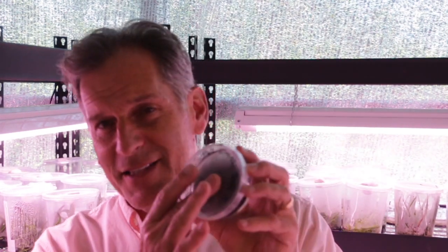The seed capsule yellowed at about the right time, and then I plated the seed. And I looked in here, and I didn't see a whole lot. The seed didn't look great. But it's now been 3 weeks. So it's been 3 weeks, and I actually can see it with a naked eye, but the plate is kind of cloudy, so you can't see it.